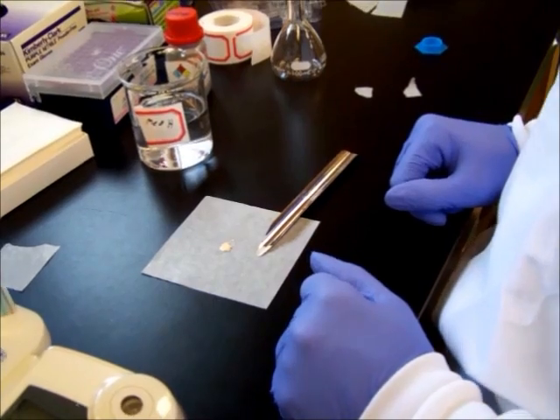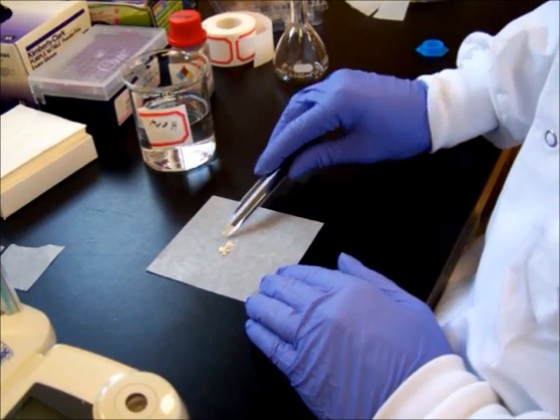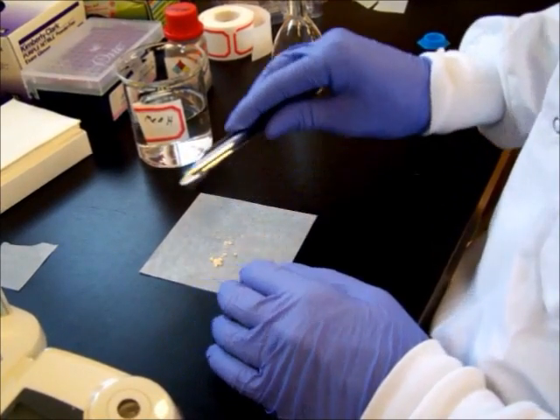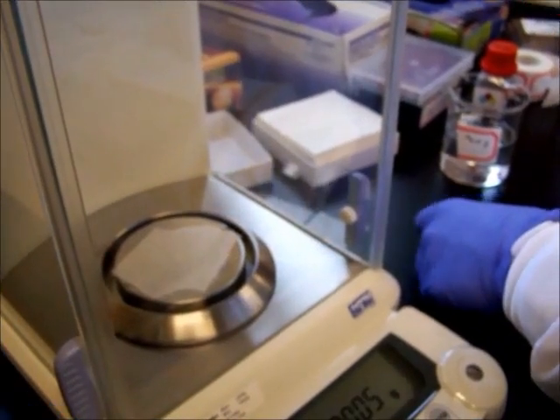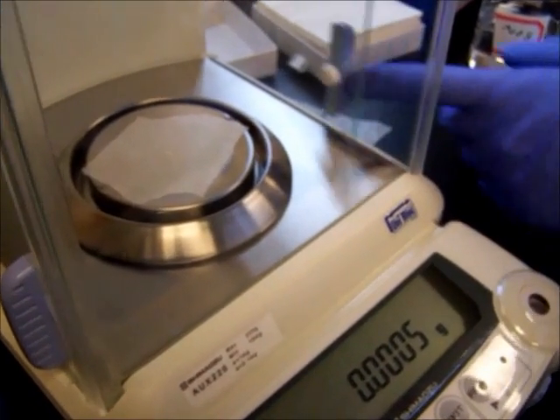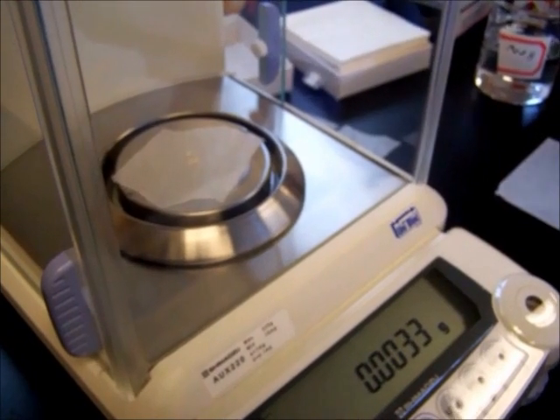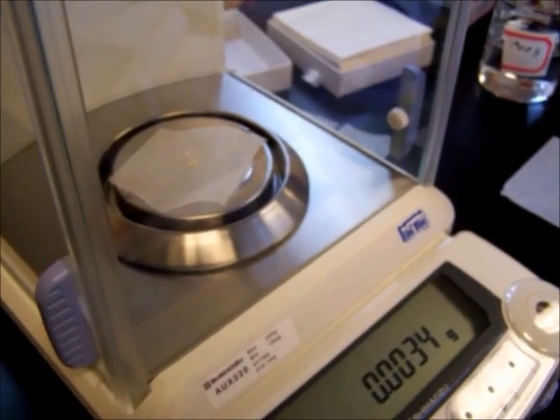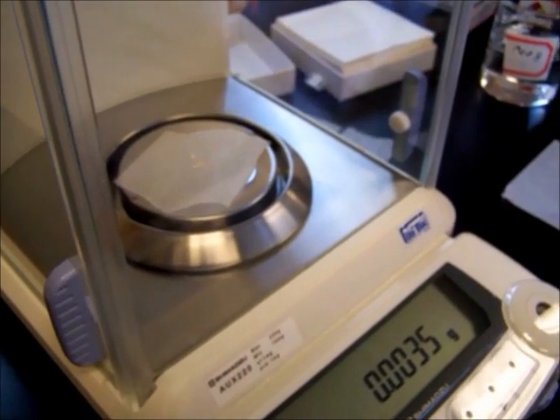We've got an extremely small quantity. Now our goal is to get down into the micromolar range, so this here is way too much for a micromolar. So what we're going to do, we're just going to take a few flakes of this. It's about that much. We're going to mass that. As the amount of material on the scale gets lower and lower, the scale becomes less and less accurate. So we're going to mass a slightly larger quantity of material. We're going to take it to about one ten thousandth of a gram, approximately.